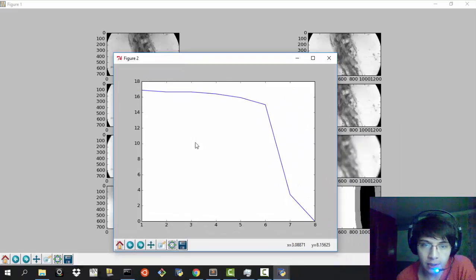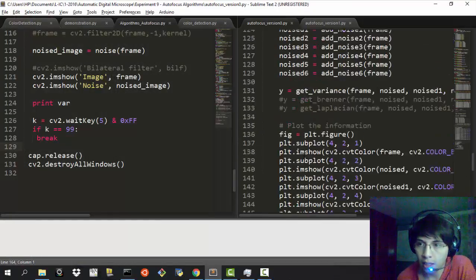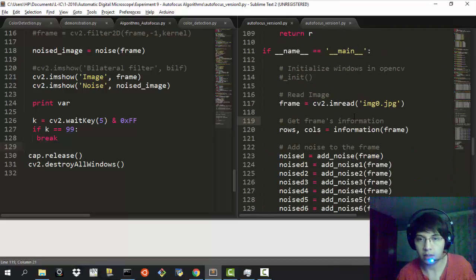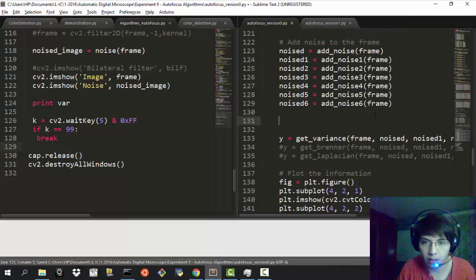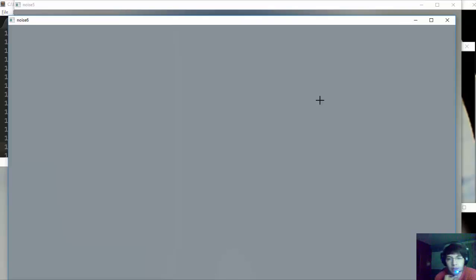As you can see, the more blurred the image is, the smaller the value that the algorithm returns. The most blurred image, which I'm going to show you in just a minute, has the lowest value. This is the curve from the variance algorithm. So I'm going to close this, and I'm going to make a very quick imshow with OpenCV so that I can show you that this is working. Okay, so this is the image that I was trying to show you.